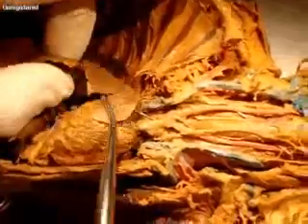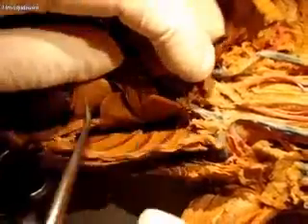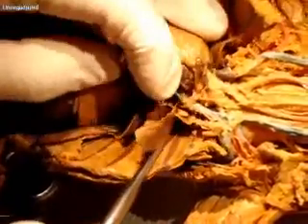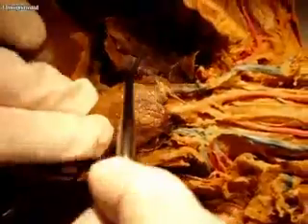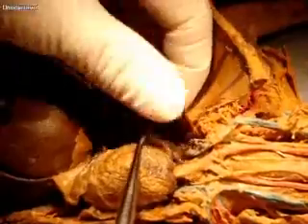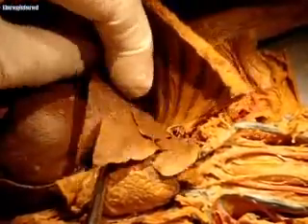You have the lobes of the lung on both sides. It looks like in this animal there are two visible. It should be three on one side and four on the other in most cases. Here's one, two, three — and this probably has four on this side. I see one, two, three — I don't see a fourth lobe, but there might be.